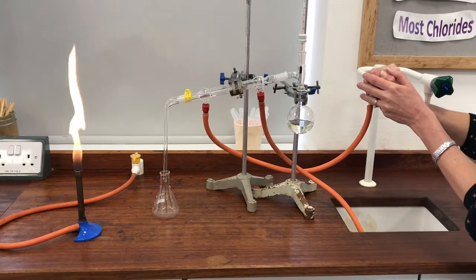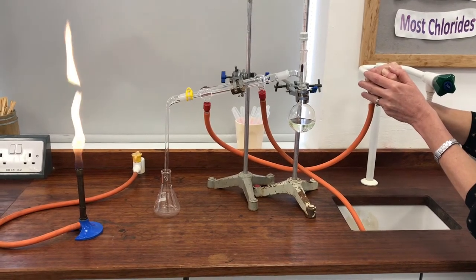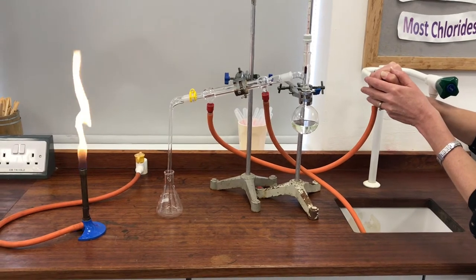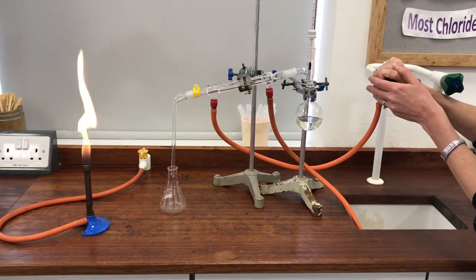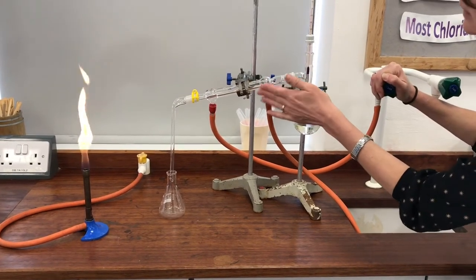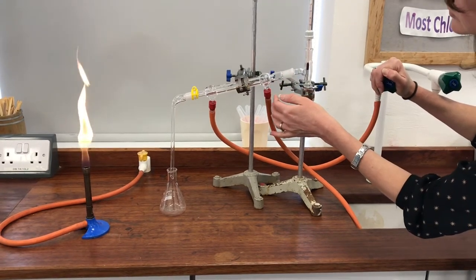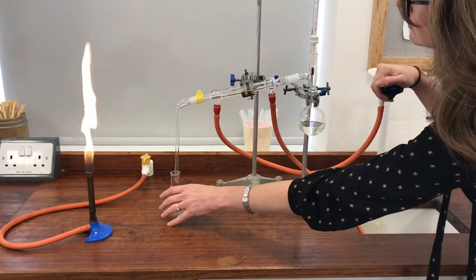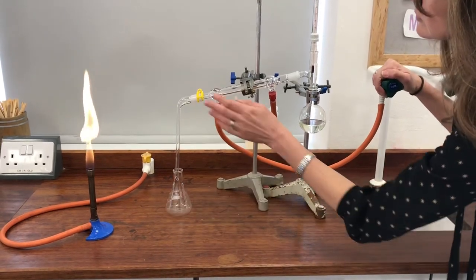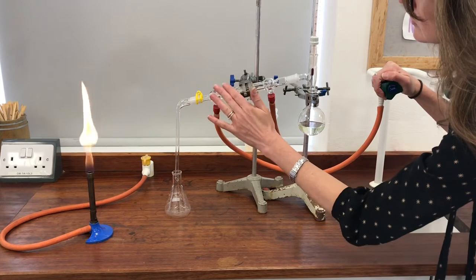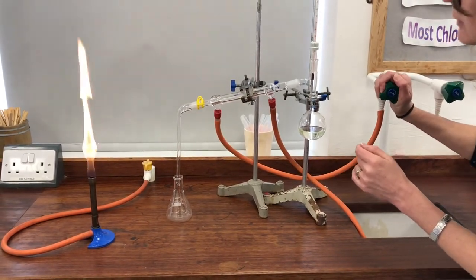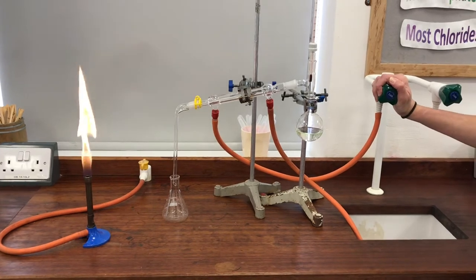Now really I want to get that bubble out of there. I'm just going to fiddle around with this for a minute and get that bubble out of there.